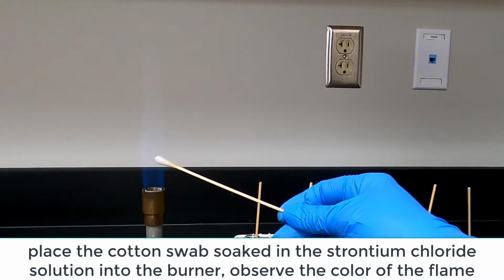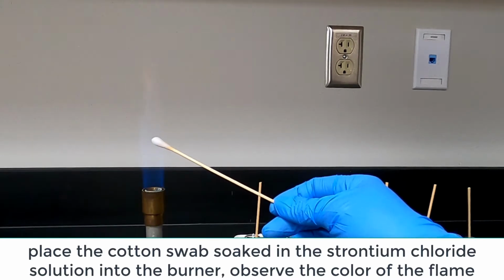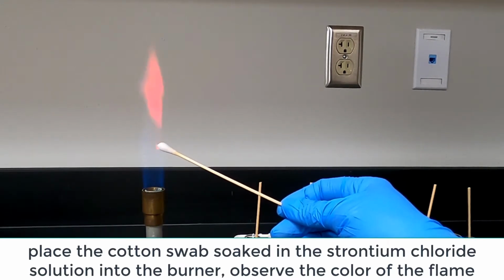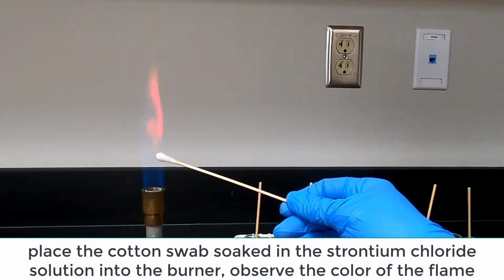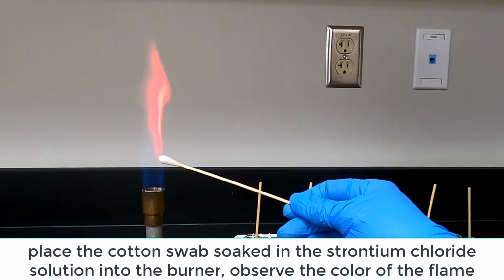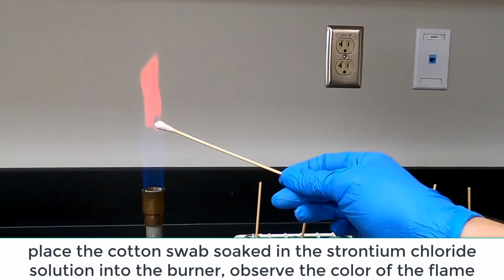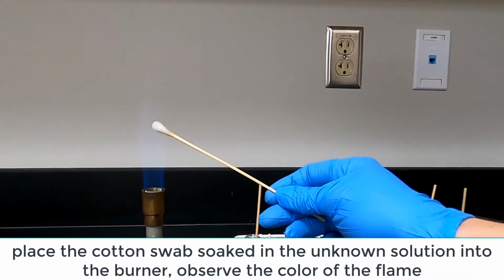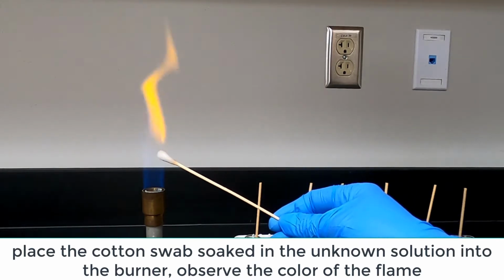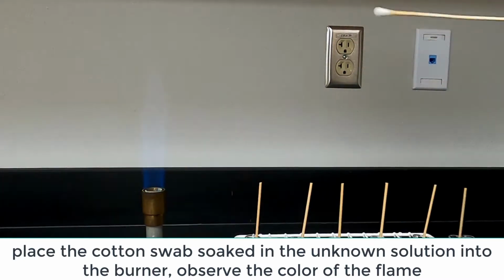Strontium chloride, record your observations on the datasheet. And unknown solutions. Record your observations on the datasheet.